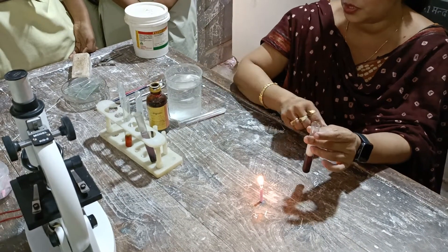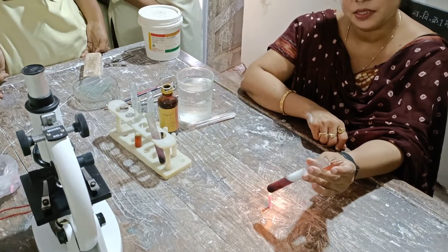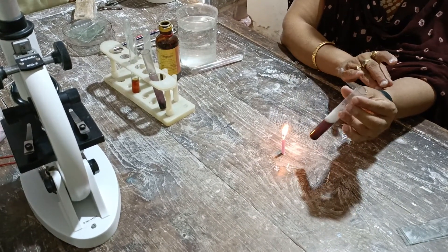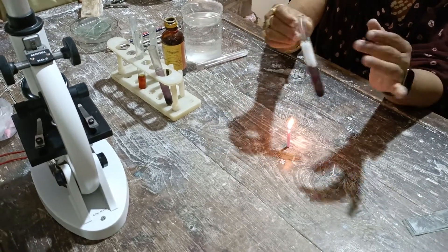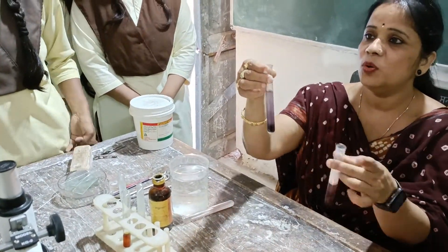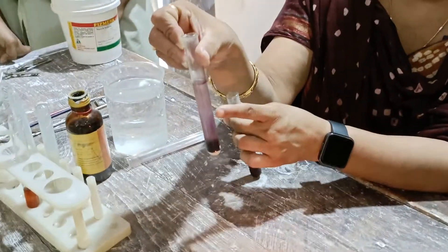So until now we have all done the heating. Now we have to see how the saliva enzyme behaves. We heated it, so the enzyme has been denatured. Here you can see — whatever color was there — we made it blue before. But here you can see the color is less — it is fading.